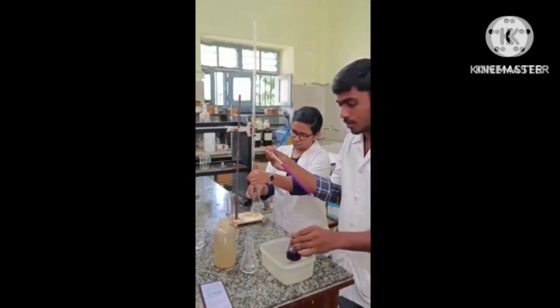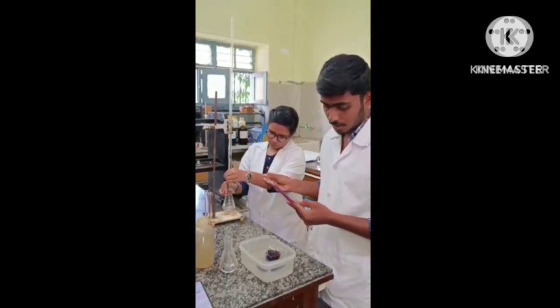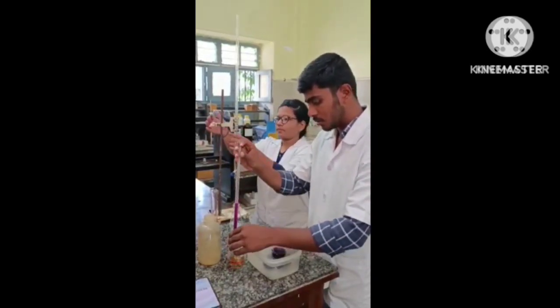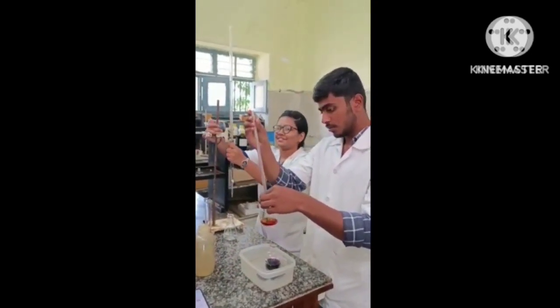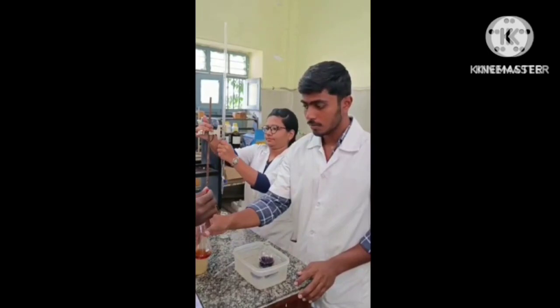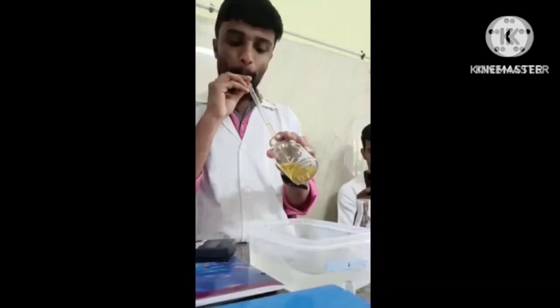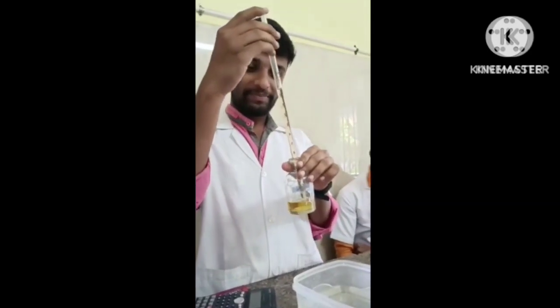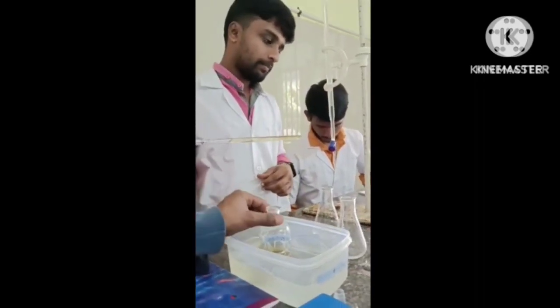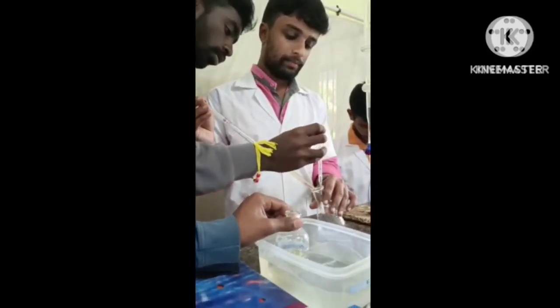After 3 minutes, again pipette out 10 ml of the solution from the reagent bottle and transfer it into a conical flask which is already having 10 ml of potassium iodide. Then add 2 to 3 drops of starch indicator. After adding, titrate it again against sodium thiosulfate until the wine red becomes colorless. After several minutes, the solution color will change in the reagent bottle. Again take 10 ml of the solution from the reagent bottle and transfer it into a conical flask which is already having 10 ml of potassium iodide and add 2 to 3 drops of starch indicator.